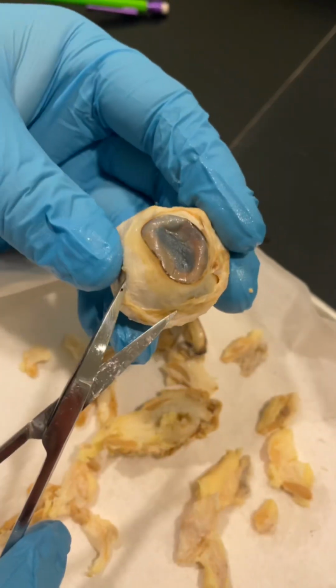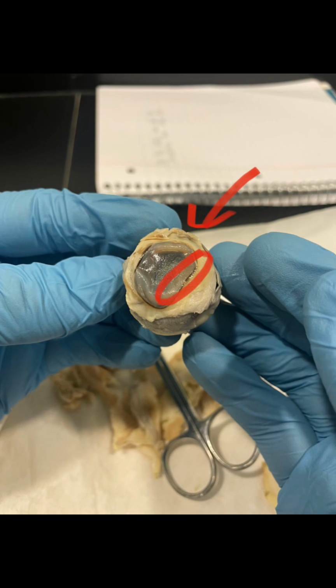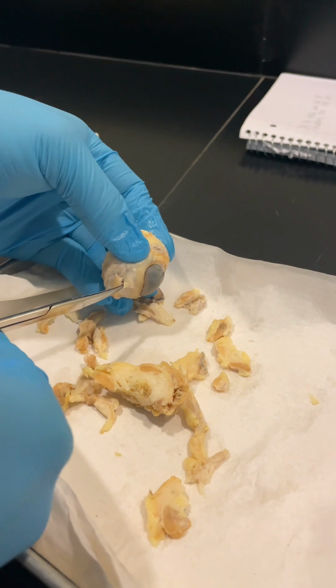that you see here. In this picture, we will be demonstrating the cornea. The cornea contributes to the outer covering of the coat of the eyeball. The main purpose of this coat is to protect structures inside the eye. The cornea is a transparent avascular tissue that acts as a structural barrier and protects the eye against infections. Along with the tear film, it provides a proper anterior refraction surface for the eye. The cornea contributes to two-thirds of the refractive power of the eye.